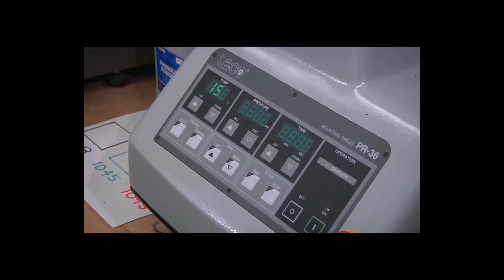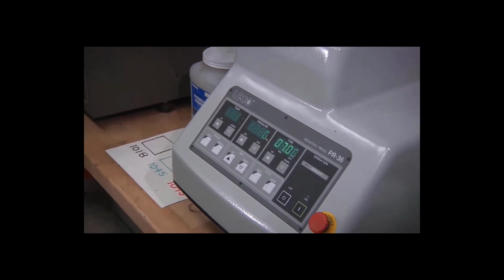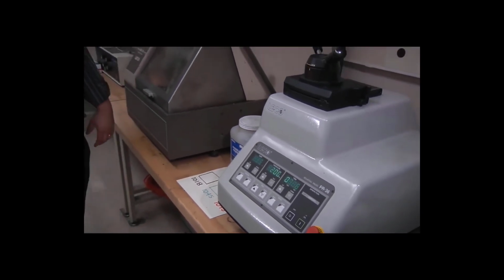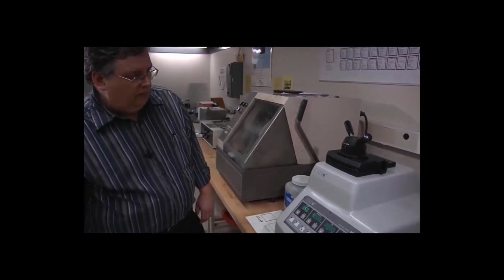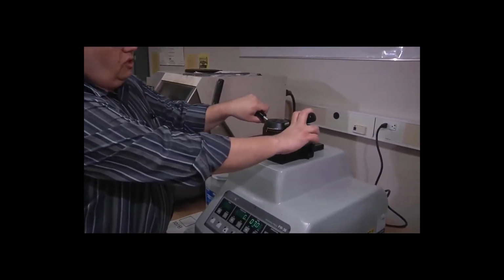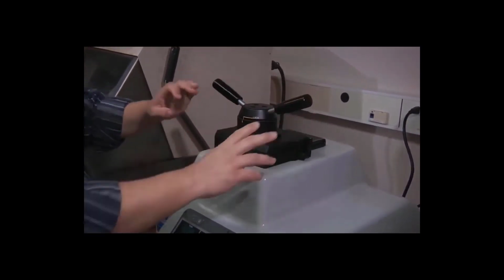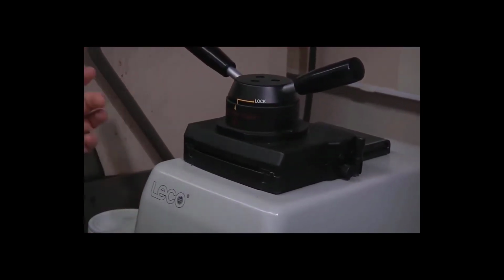Okay. So the cooling water is stopped because the temperature got down to 50 degrees after the 7-minute countdown, and we're ready to release the specimen. So to release the specimen, you simply turn the handle back to the center position. You won't be able to lift this up because now there's a solid puck of plastic in there and there's too much vacuum to raise that by hand.